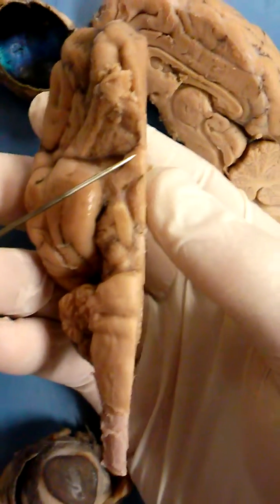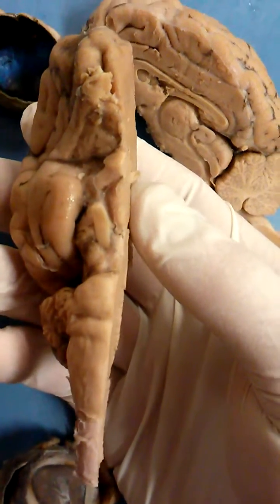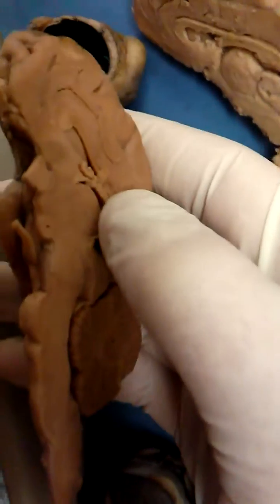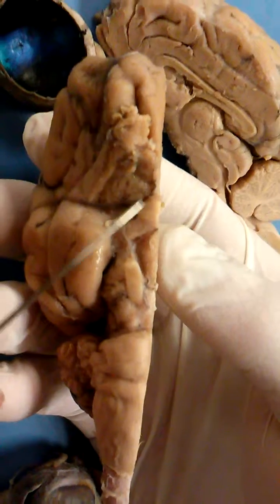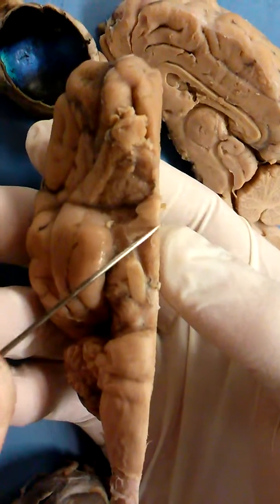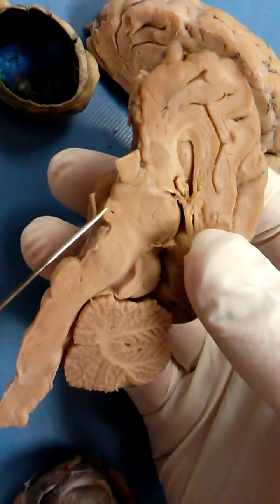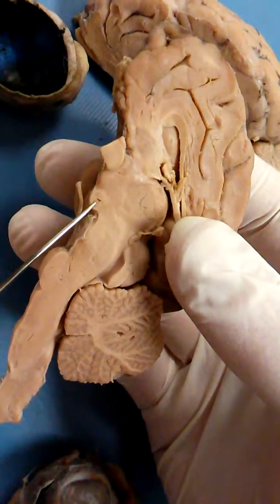Optic chiasma. The optic nerve would be coming off of here but has been sliced off. The optic nerve comes off of the optic chiasma. Right down from the optic chiasma, we have the mammillary body.